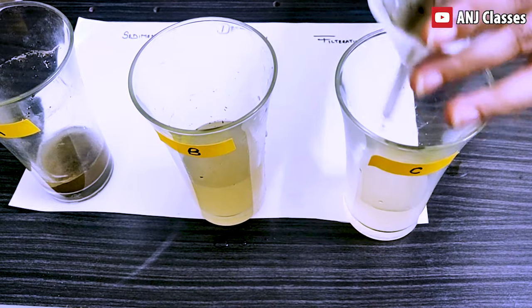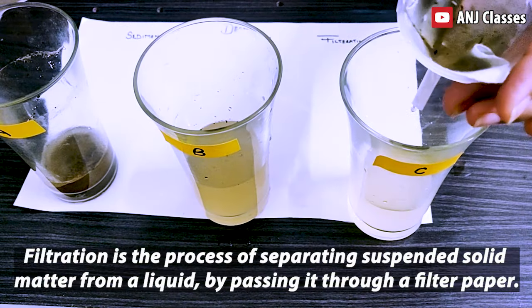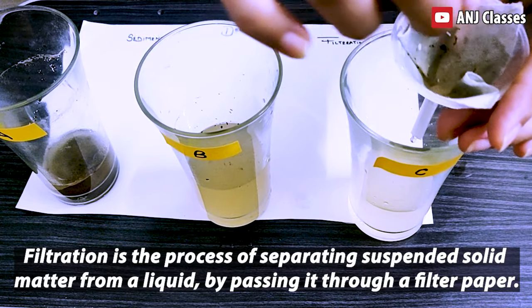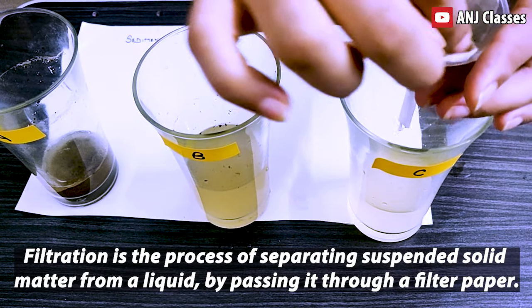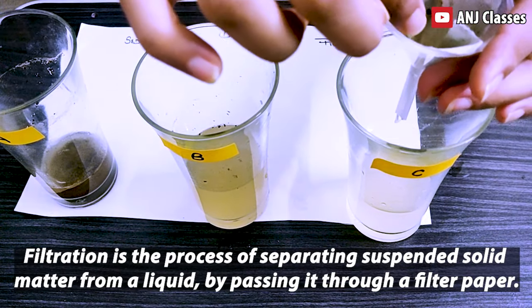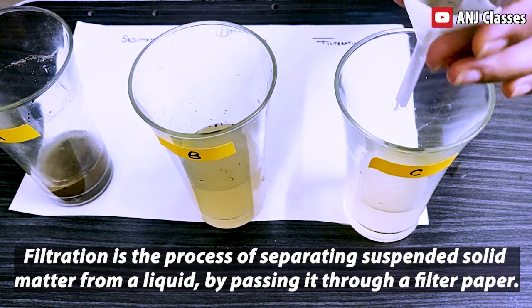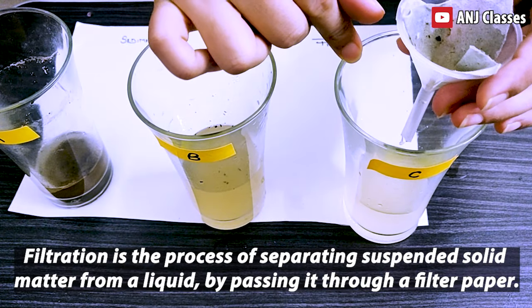You can see in this filter paper, fine impurities have settled because it has very minute, fine pores. This process is called filtration.